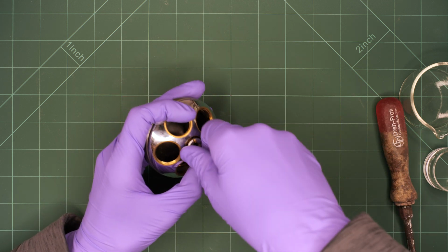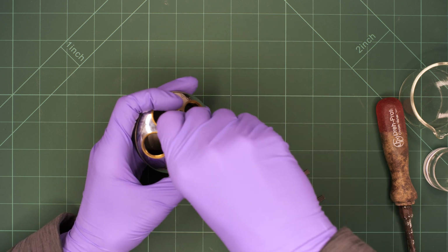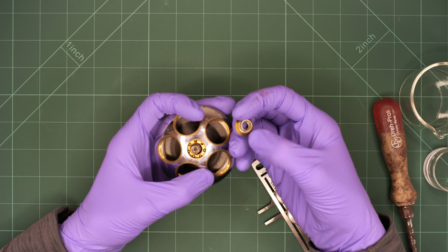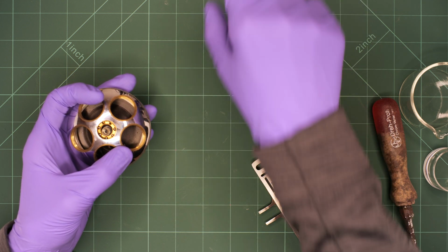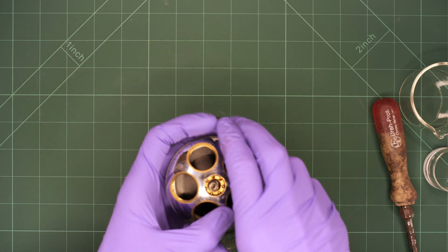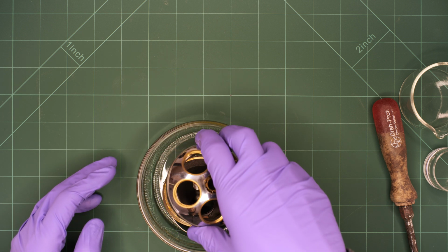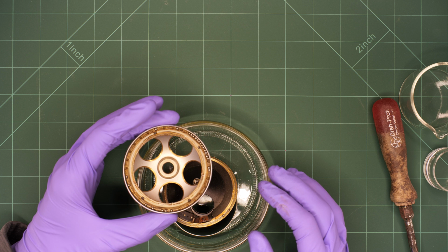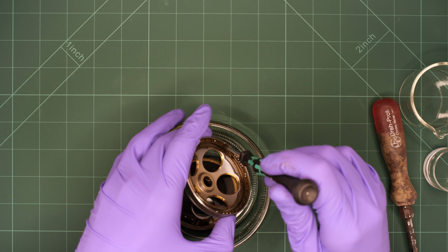After its removal, we are greeted with the first ball bearing that is held in place by a brass ring. It's important to tightly hold the nosepiece or both halves will fall apart and you will be looking for all the metal balls. I always place the nosepiece in a container to prevent the ball bearings from getting lost. Glass is not optimal as the ball bearing tends to bounce around, so ideally you choose a container made out of plastic. We are now looking at both halves of the nosepiece and we can see the second, much bigger ball bearing that is again held in place by a brass ring.